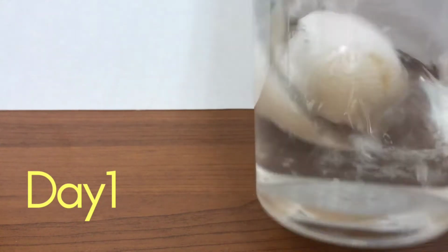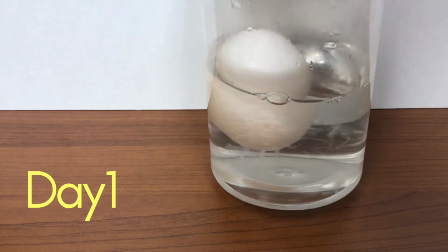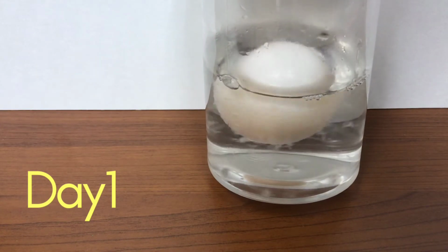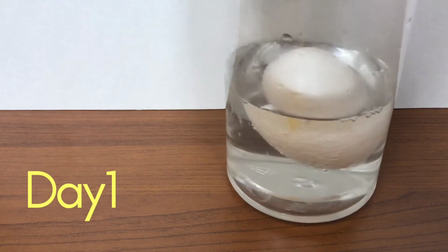This is what our naked egg is starting to look like. You'll start to see bubbles accumulating around the shell of the egg, and also the eggshell creating particles in our vinegar solution.